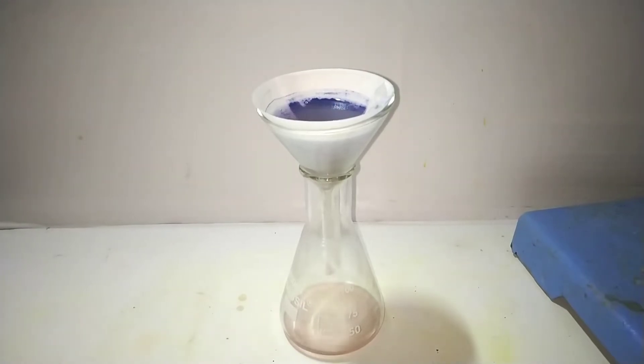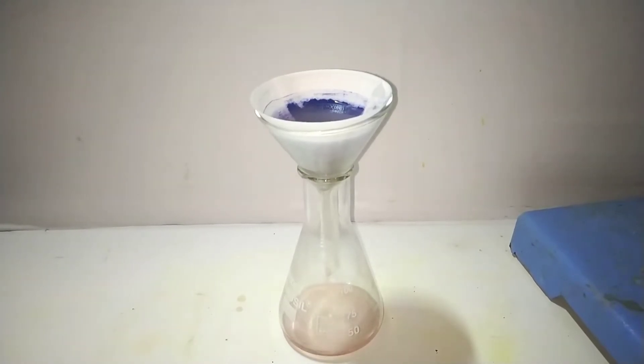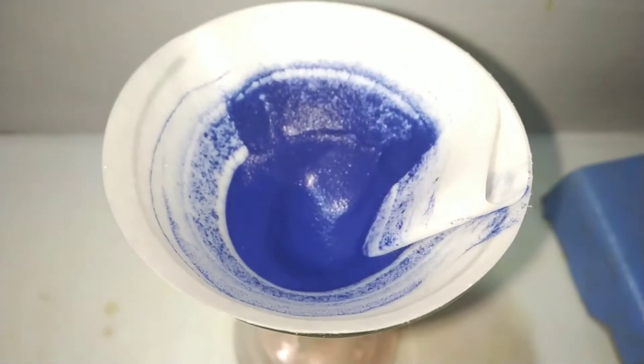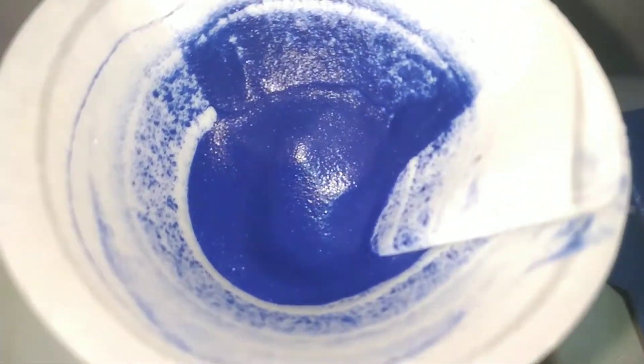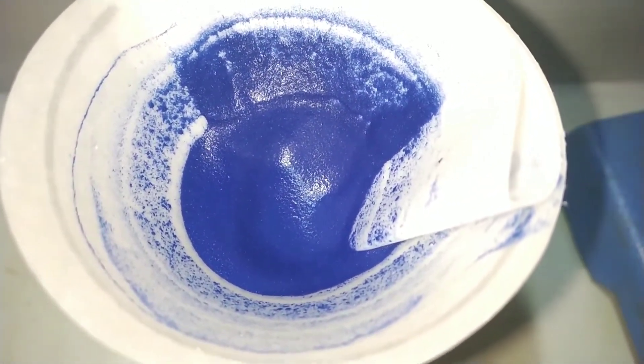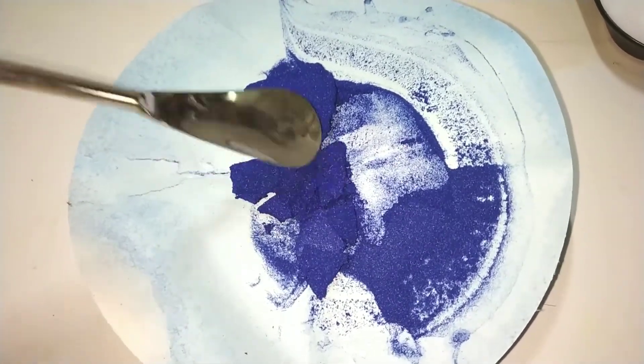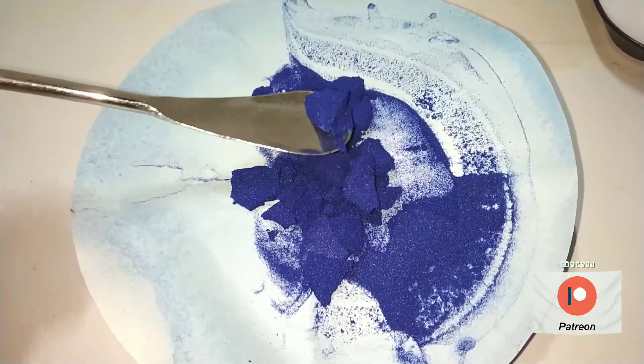After 30 minutes the contents of the beaker was filtered using a simple filtration method. These are the crystals of the product obtained. It was then placed under the sun for drying and after drying here we have the final product.